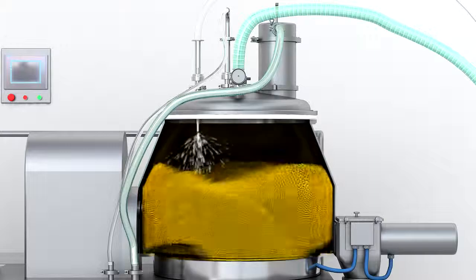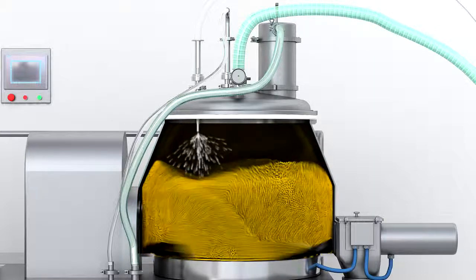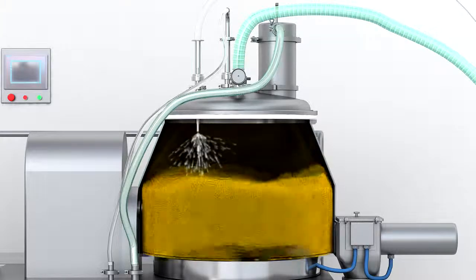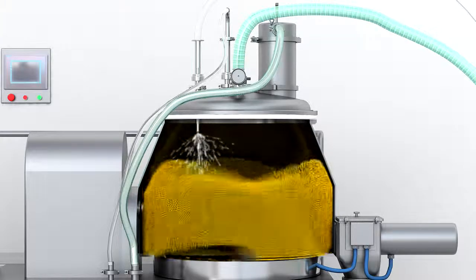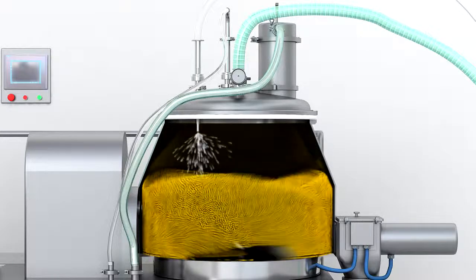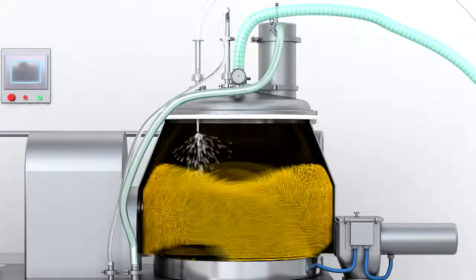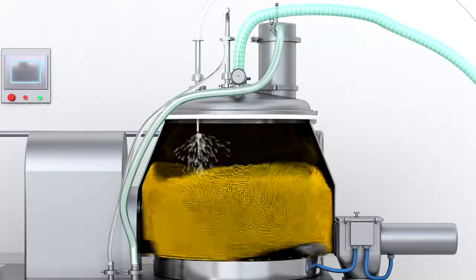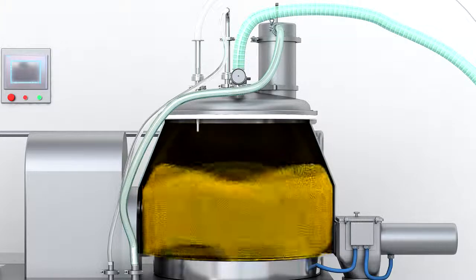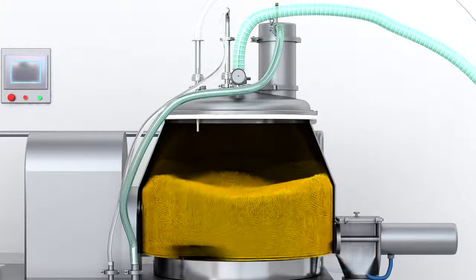After mixing uniformly, the solution spray system automatically works. The clean compressed air in the solution loading tank extrudes the binder from the pipe to the nozzle on the lid of the container, making the binder spray onto the materials in a sector-shaped surface. The spiral fluidized materials mix with the binder adequately, forming homogeneous solid granules.